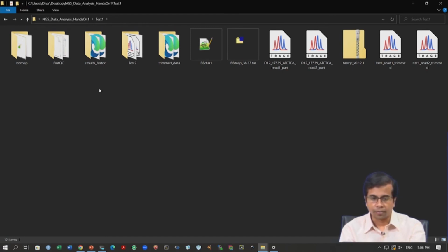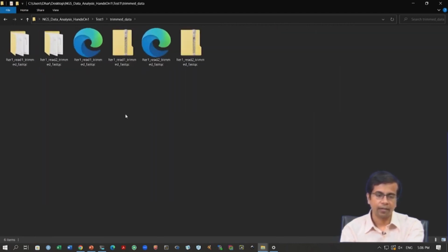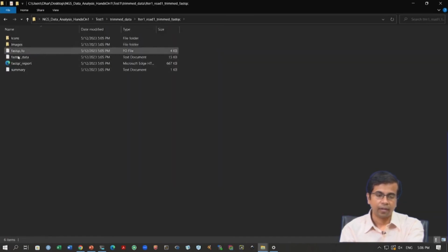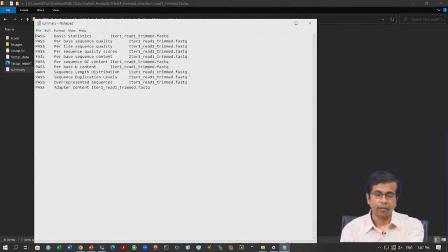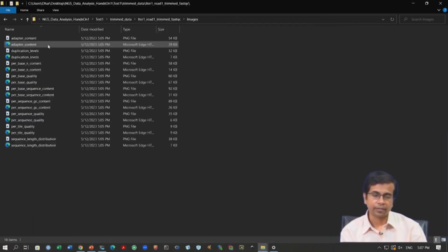Okay. All right. So, let us see where is the data? Yeah, so here is the trim data, and we can go inside, and again let us look at the summary. Okay. Now, the summary says everything is passed except per-base sequence content. Okay, we are not worried about that too much, but it now gives a warning about sequence length distribution. Okay. So, this is something that is new, and if you think about it, this is expected. If you are trimming sequences, your sequence length distribution will change and some of the reads might be very, very small. Okay. So, let us go into the images, and this will tell us the full story.